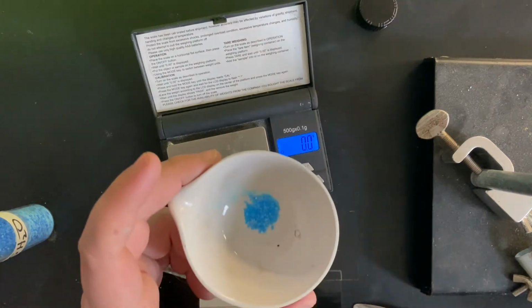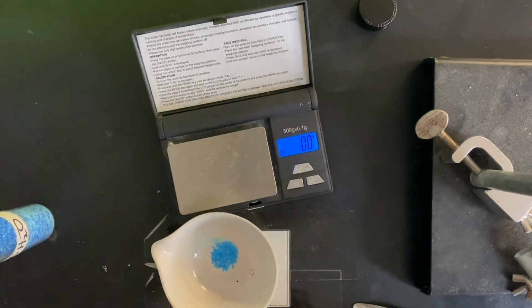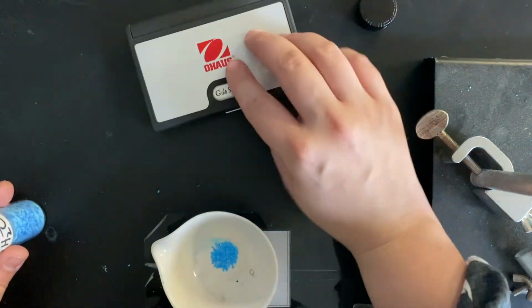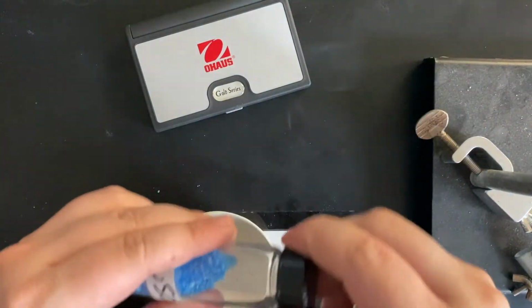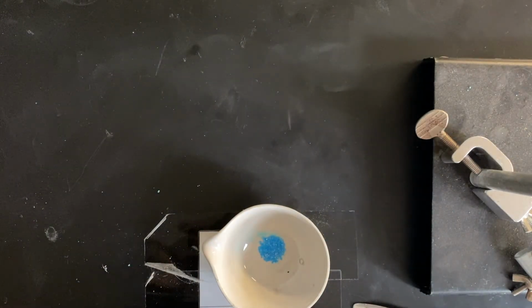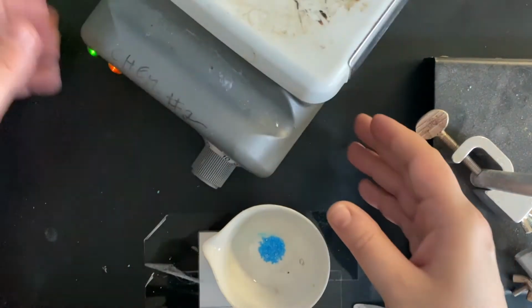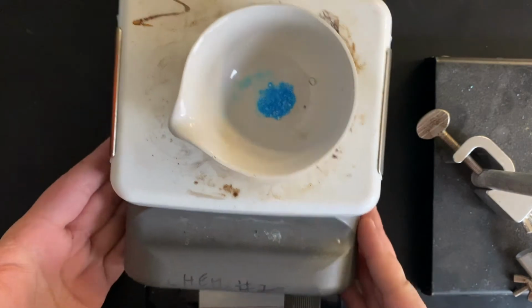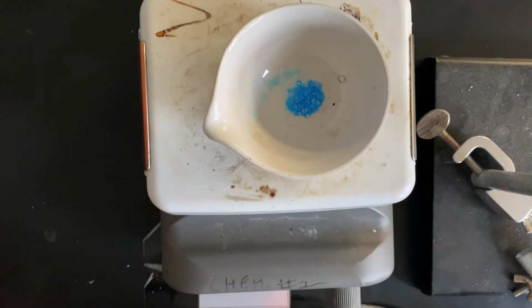Now what you're going to do is heat this up. Now at this point, your hot plate is going to be pretty warm. So we'll close that, turn it off, cap this. Again, we only need a little bit. We're going to take our hot plate and very carefully place our hydrate on the hot plate. Now it should take about 5 minutes. Do not heat this up for more than 5 minutes.